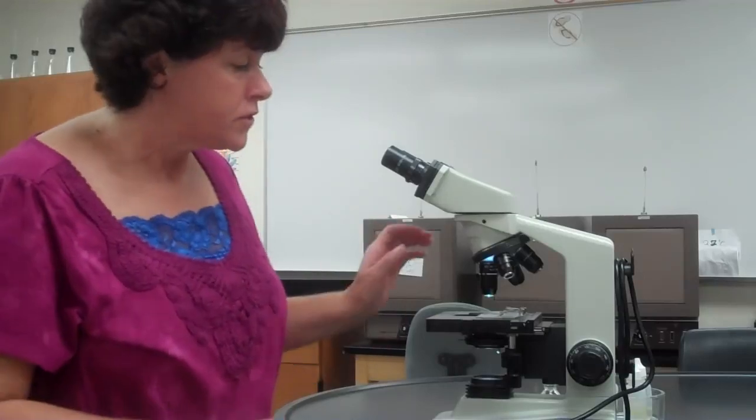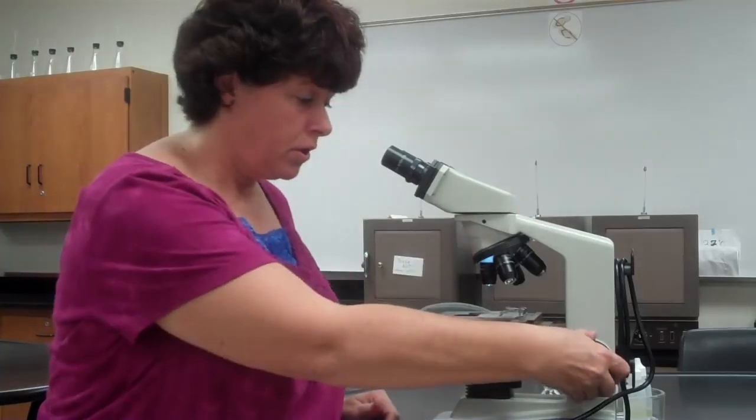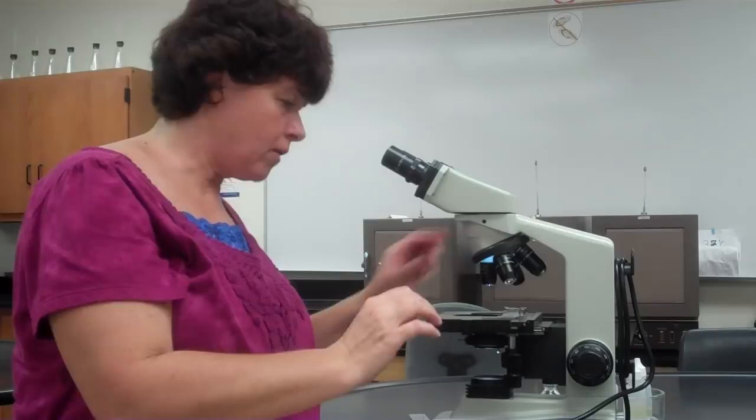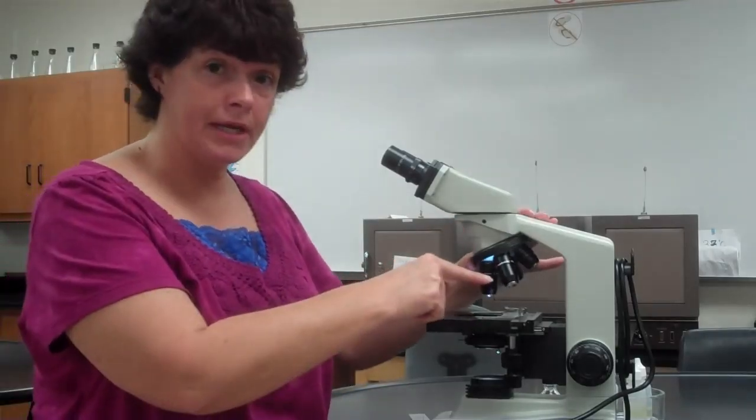So now I'm done. I found my specimens, I've done my drawing, I'm done with the slide, okay? So what you're going to do, remember it was way up there on the 100. You're going to go to a lower power, lower the stage, remove your slide. Now, we need to get the oil off of the 100 lens. To get the oil off the 100 lens, you use lens paper. Don't use any other kind of paper.